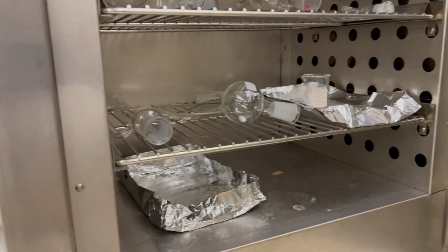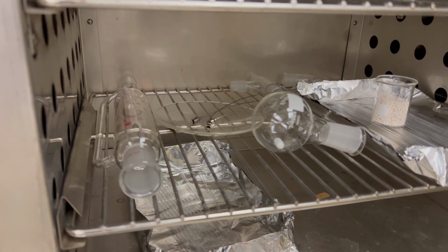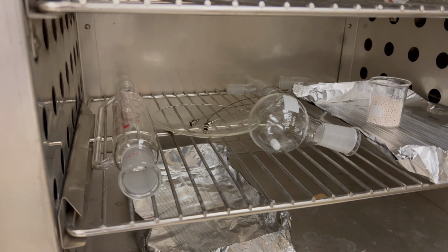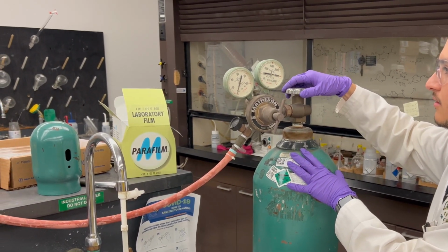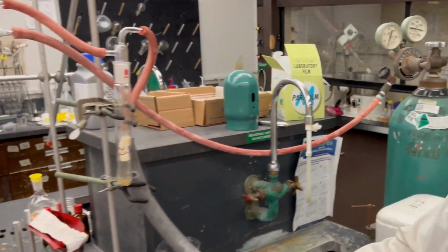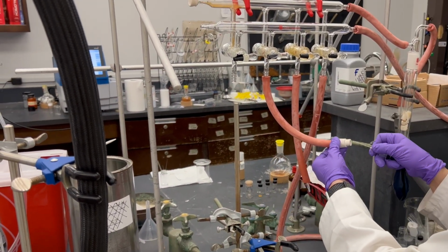The round bottom flask, stir bar, needles, and addition funnel need to be clean and water-free. We use an oven to dry our glassware, but other methods of drying glassware can be used per other reaction conditions. The next preliminary step is making a nitrogen-filled balloon. This will be used to mitigate moisture contamination within our round bottom flask and addition funnel apparatus.